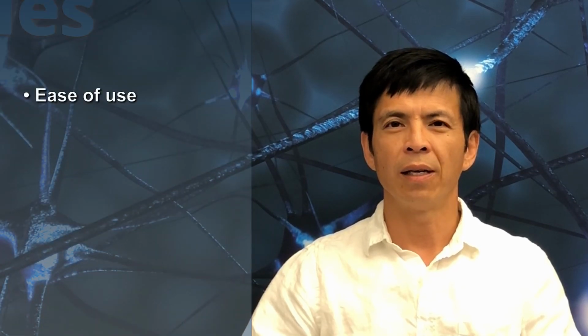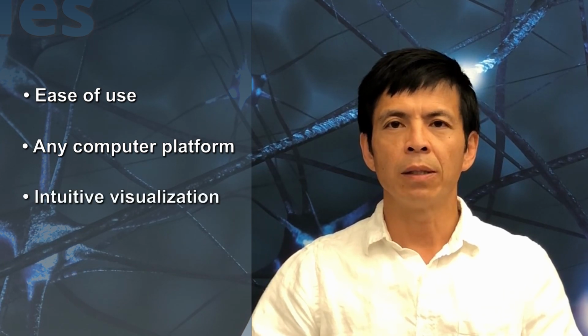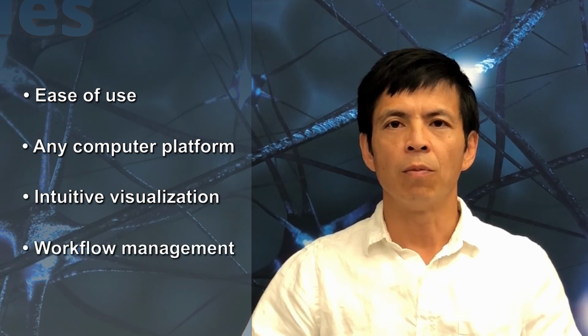So to wrap up, some of the unique strengths of Sourcerer are its ease of use, ability to run on any computer platform, visualization capabilities that are intuitive, allowing the user to explore the results, and its workflow management to minimize wait time.